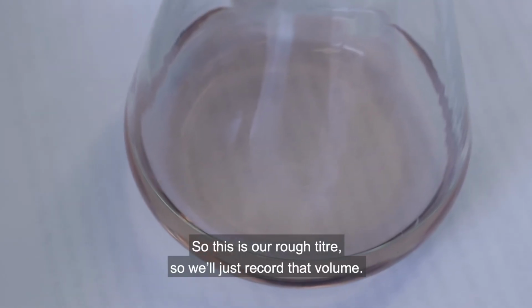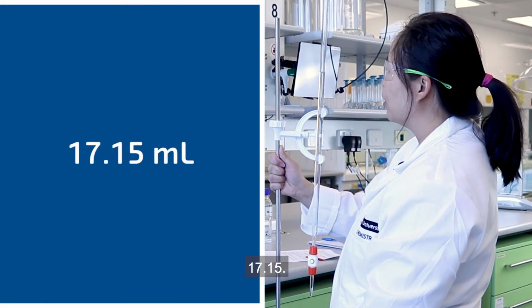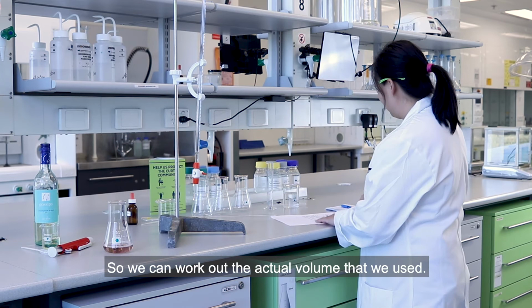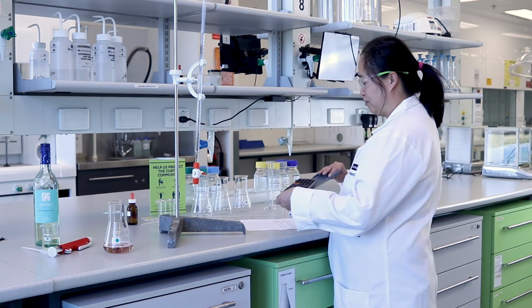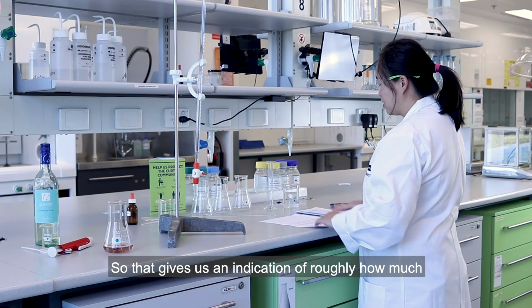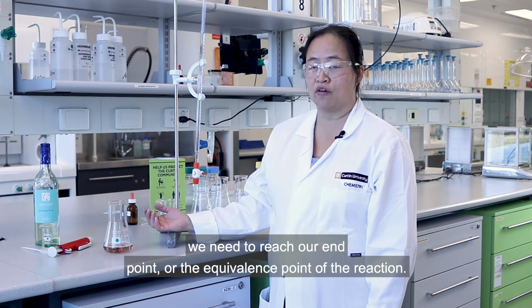So this is our rough titer. So we just record that volume, 17.15. So that's our first rough titration. So we can work out the actual volume that we used. So you can just use a calculator for this. 16.5 mils. So that gives us an indication of roughly how much we need to reach our endpoint, or the equivalence point of the reaction.